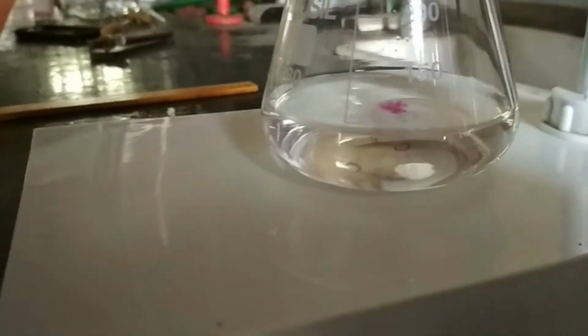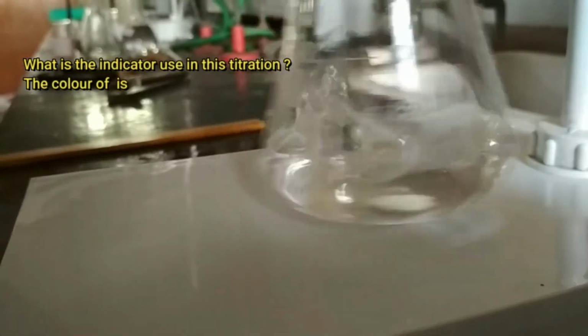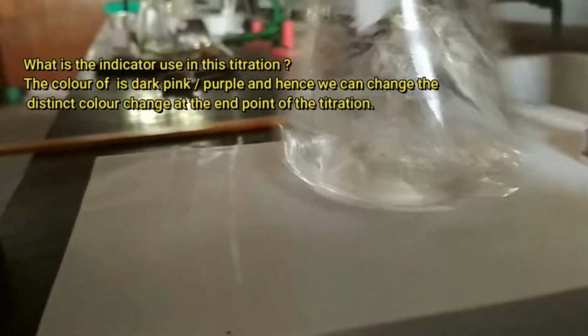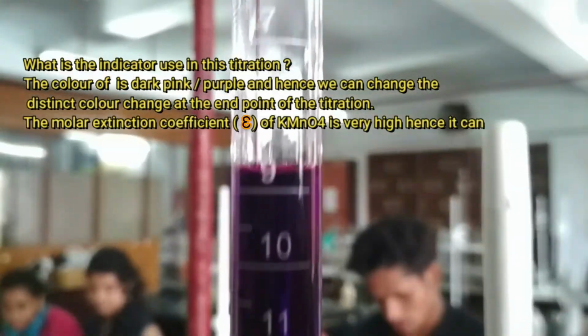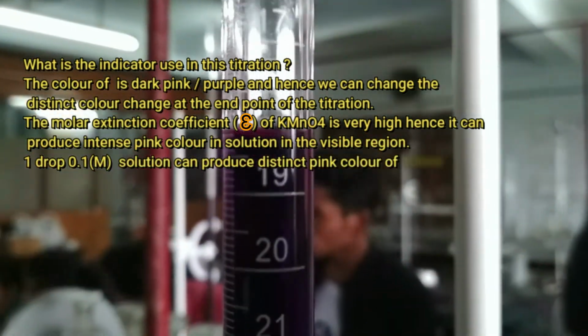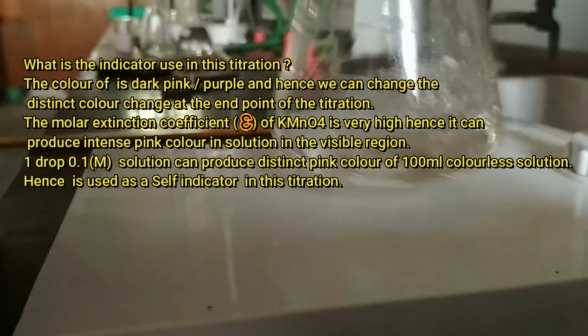Another interesting feature of this titration is the indicator. What is the indicator used in this titration? The color of KMnO4 is very dark pink or purple, and hence we can spot the distinct color change from colorless to pale pink at the end point of the titration.